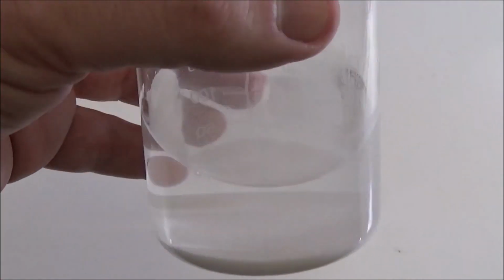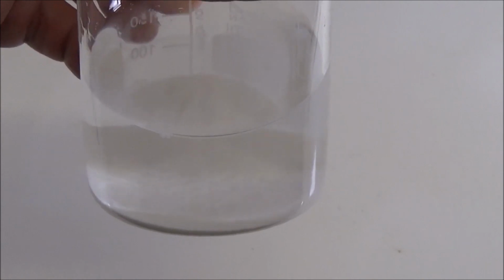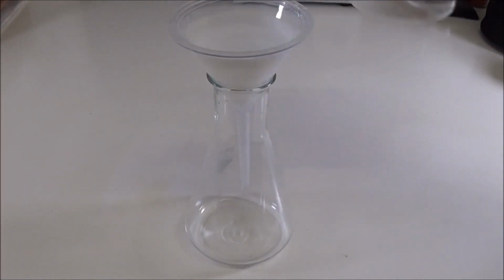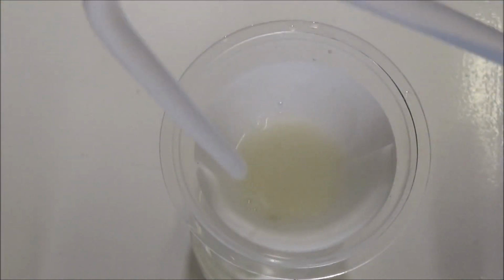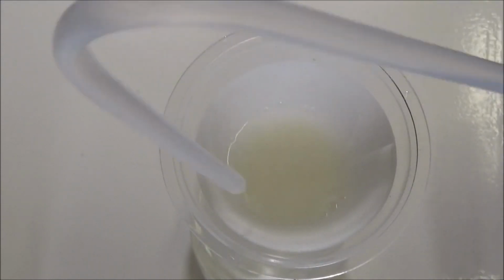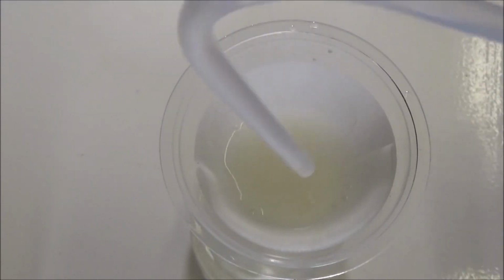After stopping the stirring, the precipitate settles out very quickly. We separate it again using a simple filtration. The filter cake is then rinsed twice with distilled water in order to free it from adhering residues of unreacted barium hydroxide solution and excess hydrogen peroxide.